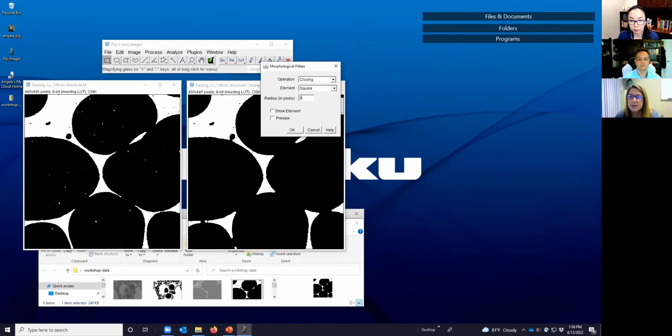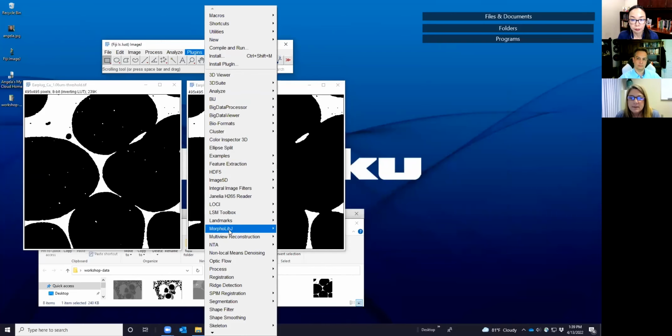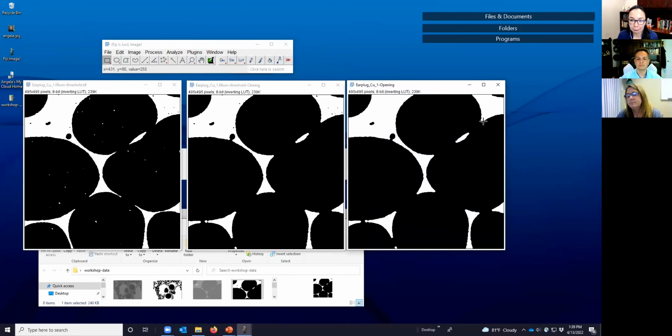let's see, 3, disc shaped, and okay. Then we see here that, oops, I did the wrong one, guys. Let's go back and go here and select. You always have to make the window you want to operate on active before you do this in ImageJ. Yes. Okay. Have I had the wrong one? Yes. So here we go.